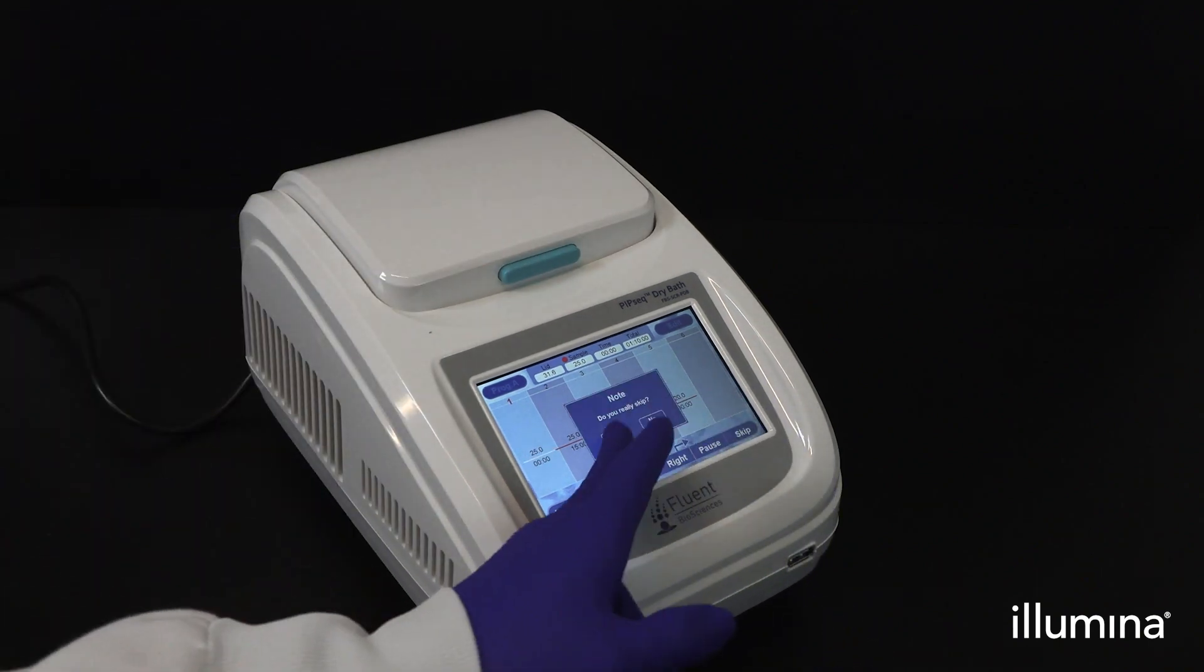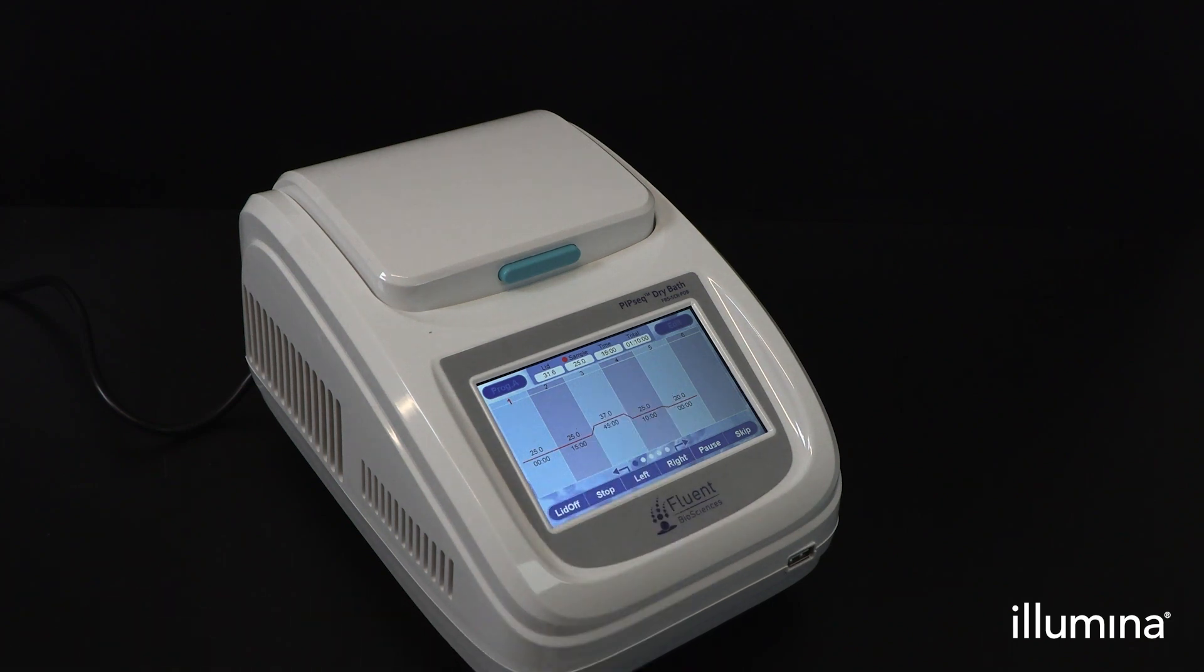After incubation is complete, this is the first stopping step of the workflow. Samples are stable at 20 degrees Celsius for up to 96 hours.